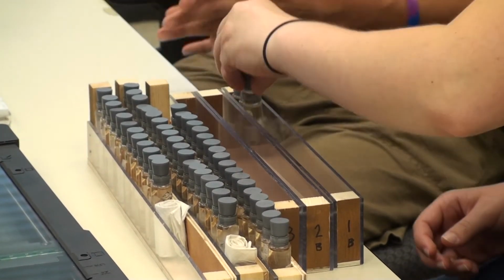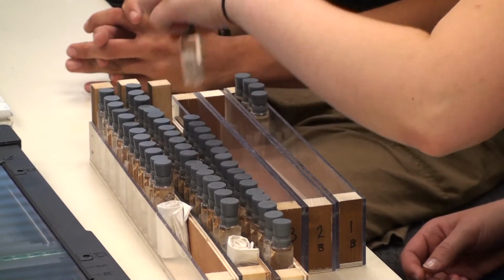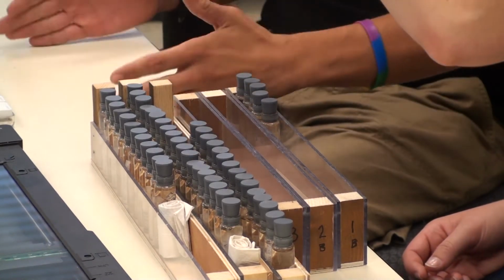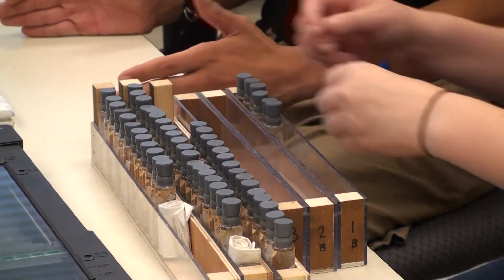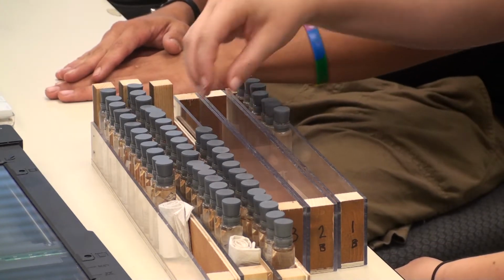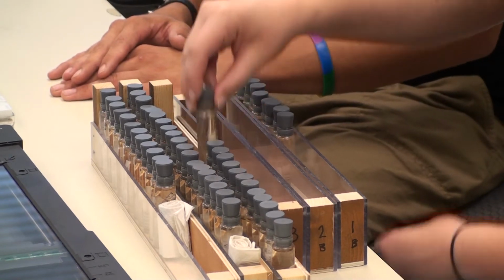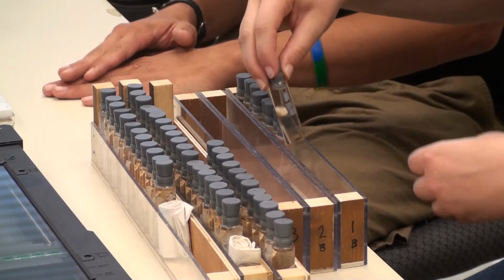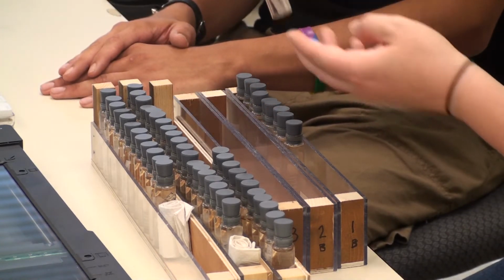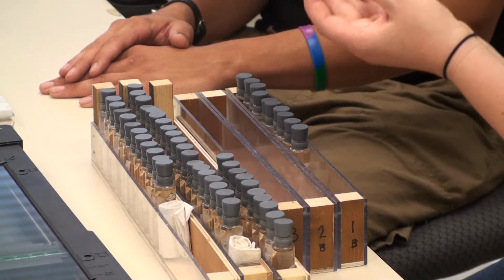Now this is much faster than the traditional way of capturing label data from vial collections. It used to be that we would pull each of the labels out and lay them onto a scanning bed and image just the labels. However, as you can imagine, this could, well, cause a lot of confusion. You can mix up labels, you can lose labels, you can also damage the specimens while you're doing it. This is a less invasive way of just capturing the data for upload to a collections database, or in this case, InvertNet.